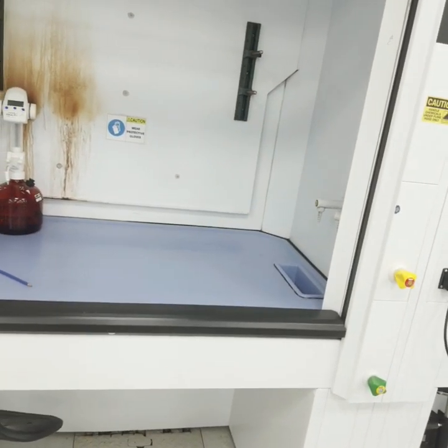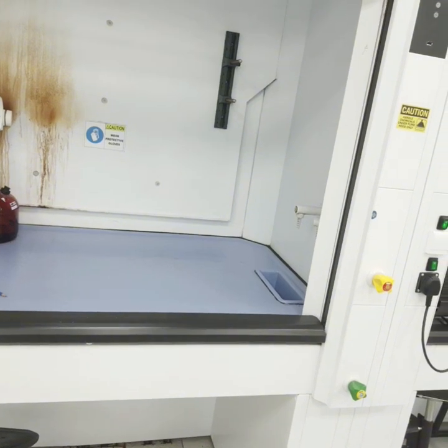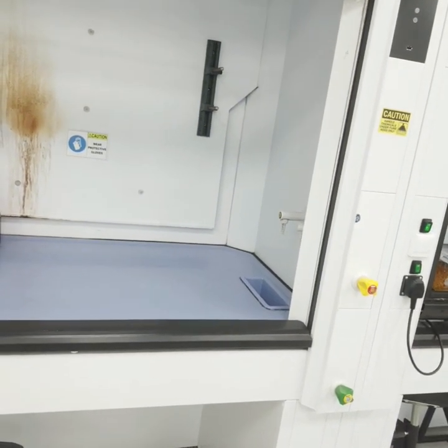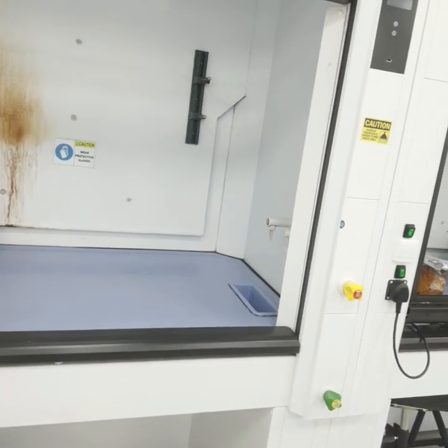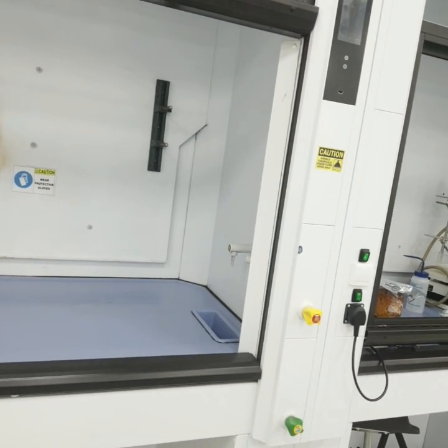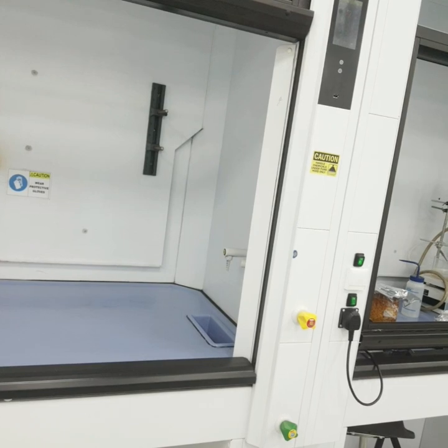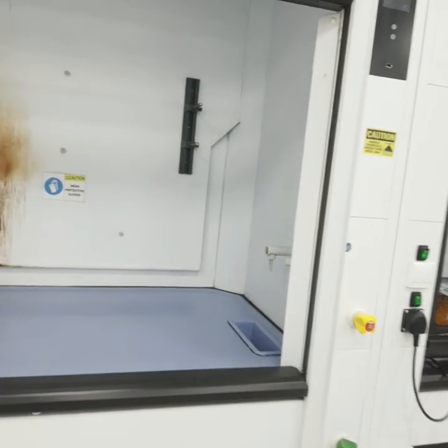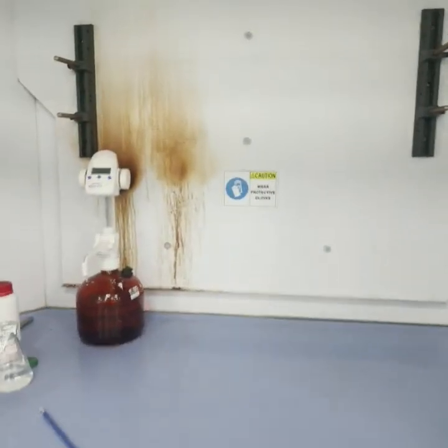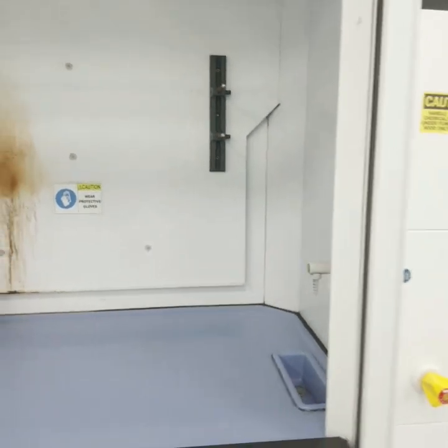When working with acids, highly corrosive bases, or similar chemicals, you must use a lab coat and gloves that are non-powdered and non-reactive. You should also protect your eyes with safety shields or safety goggles.